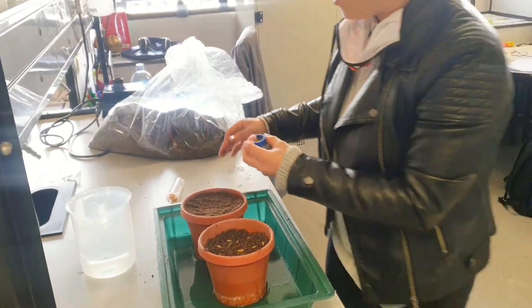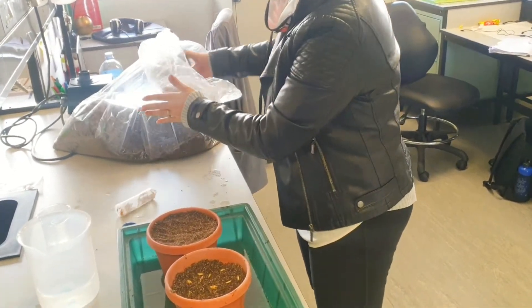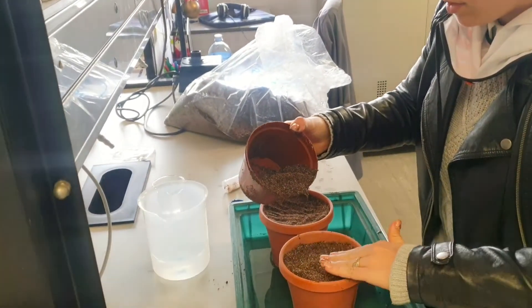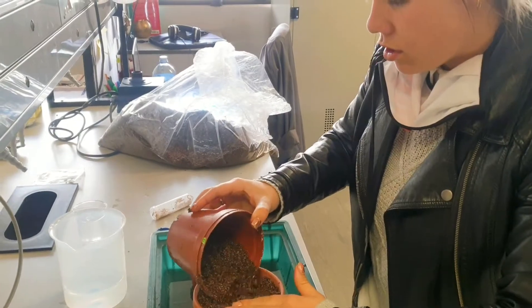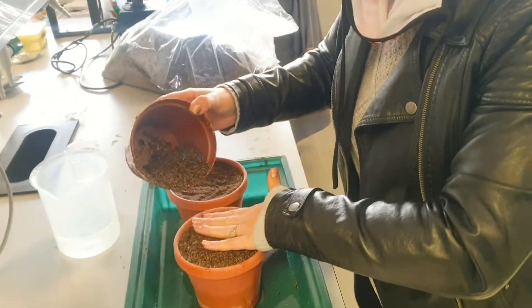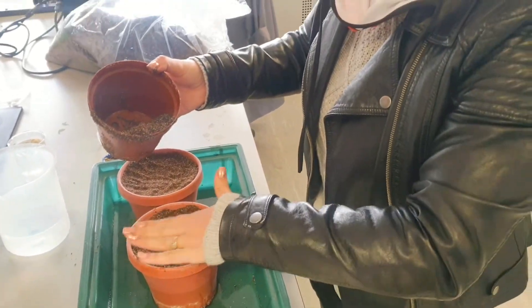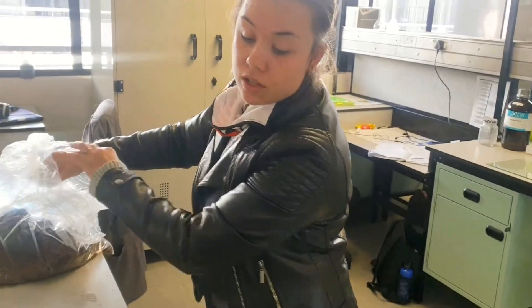Once you have your seeds in the pot, you just cover them with soil. I press it on gently — I don't compress it too much, just make it even so that everything is covered nicely. Once this is done, I normally put them in a well-lit area.